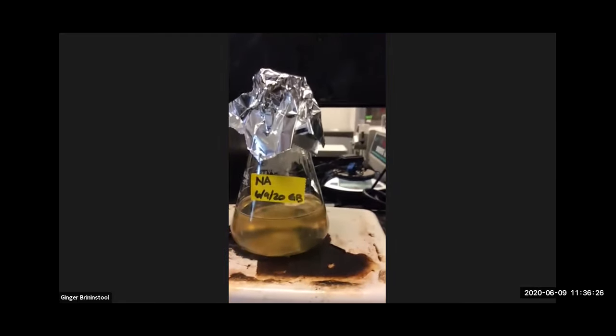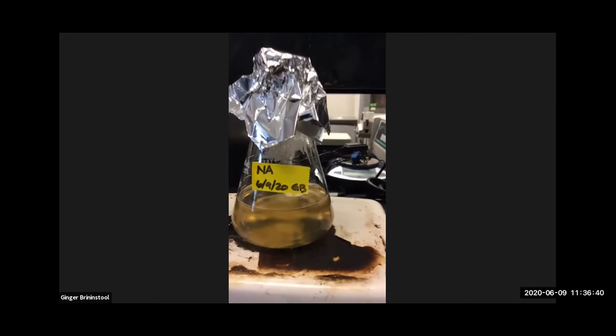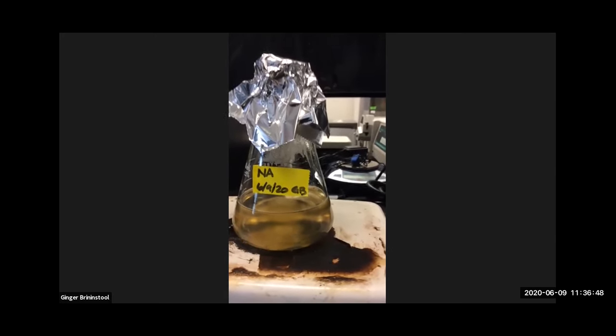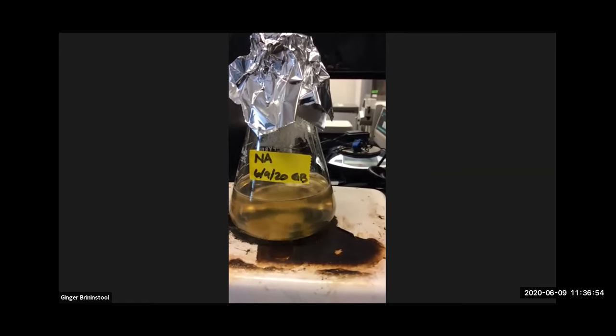Once these go into solution and they're ready for the autoclave, we will make our way across the hall. We made media last class, last section. Their media is in the autoclave right now, and we will take theirs out and use it to make some plates. I'll show you how. And then we will go downstairs to the lab in order to inoculate some plates.